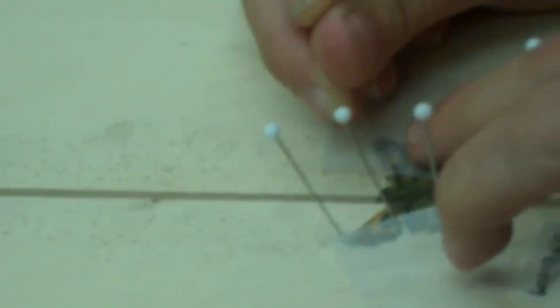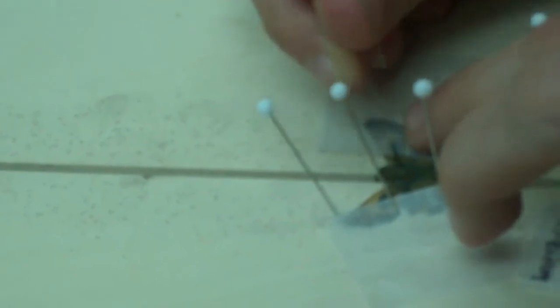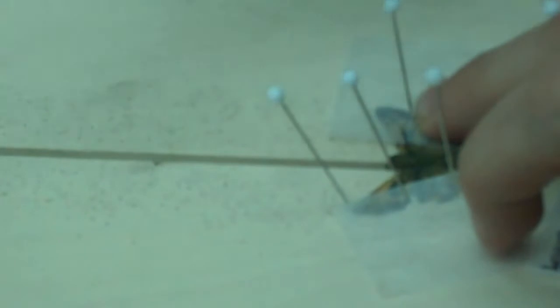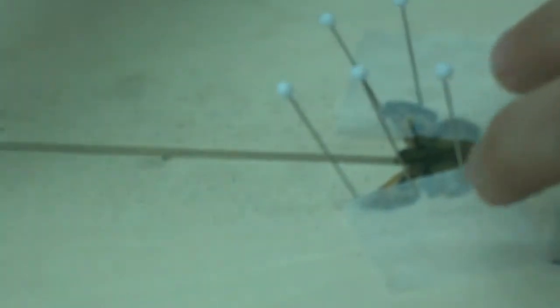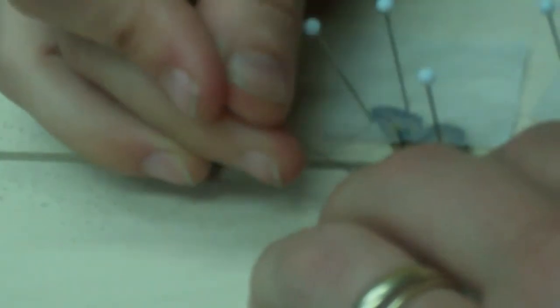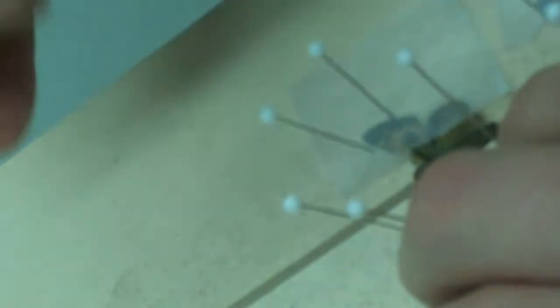I'm just moving it little by little. And this takes years and years of practice to be able to do well. You want it to be as symmetrical as possible. And your aim is both to make it look pretty and to make it so that you can see all of the characters on the wings. You can see all of the characters.